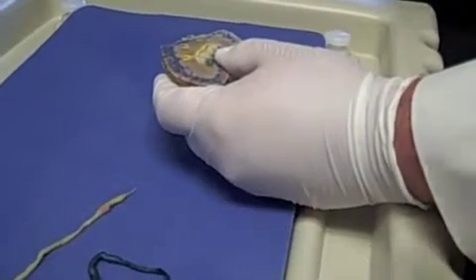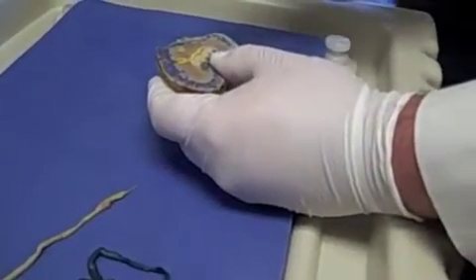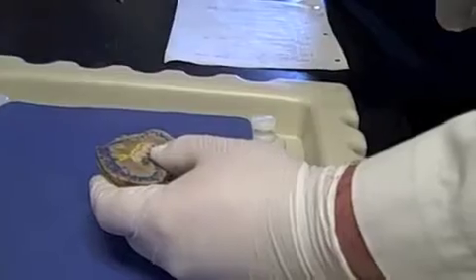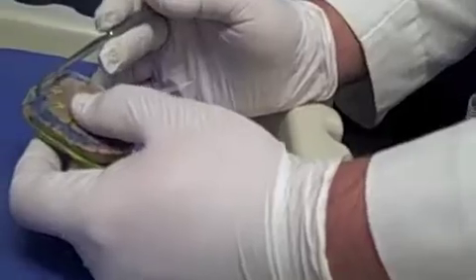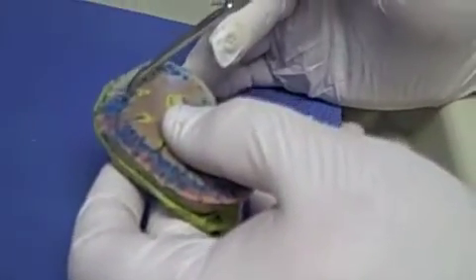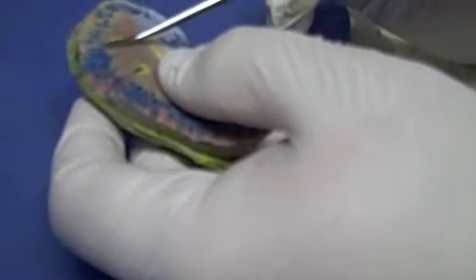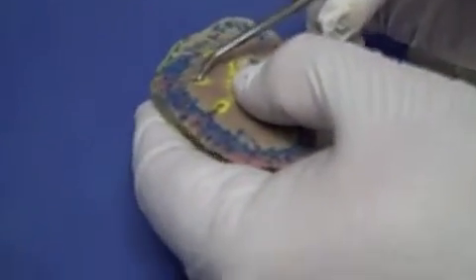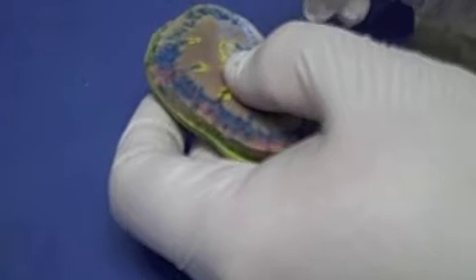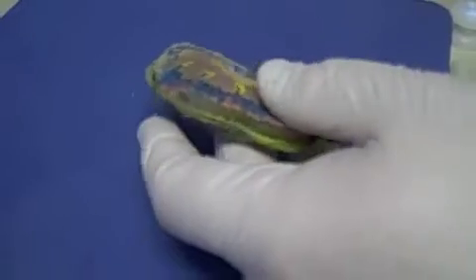Now, the afferent arteriole, the glomerulus, the efferent arteriole are way too small for us to be able to see on here. Okay? But after that blood has been processed, it's going to be collected back down into interlobular veins right there, coalesce with one another to give rise to arcuate veins right there and right there, which coalesce with one another to give us interlobar veins right there or right there, which will eventually coalesce to lobar veins, okay, and then finally a renal vein, which you guys can see right here.